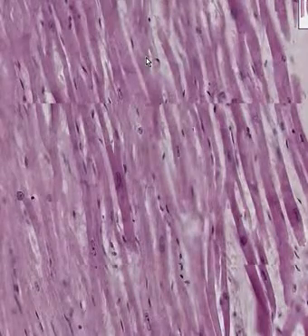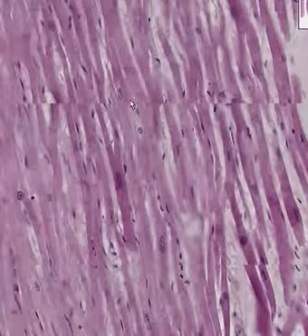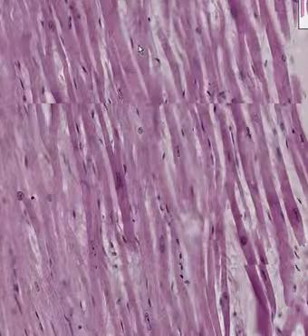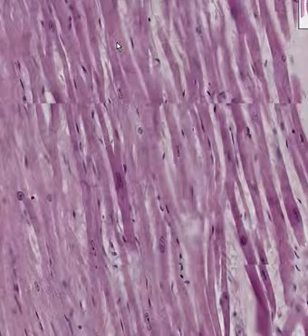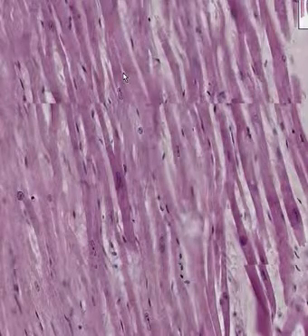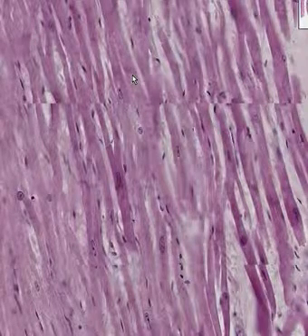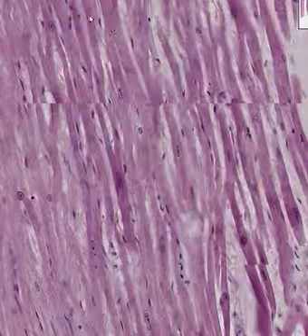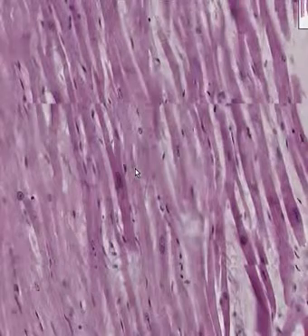Cardiac muscle is also striated, but not as neatly as skeletal muscle. It has the nuclei in the middle of the fiber, it has intercalated discs, and the fibers branch to connect with adjacent fibers because the method of contraction is not linear — it's in multiple dimensions. The fibers are also not quite as thick as voluntary striated skeletal muscle fibers; they're a little bit smaller. So there we are: all three types of muscle on one nice slide. I hope that I've convinced you that there's no possible way you could ever confuse skeletal from cardiac muscle for the rest of your life. Thank you very much.